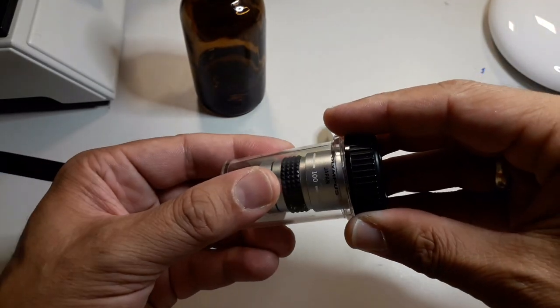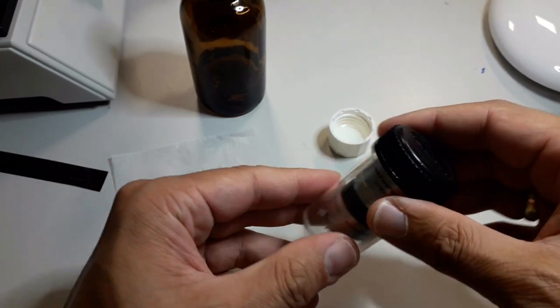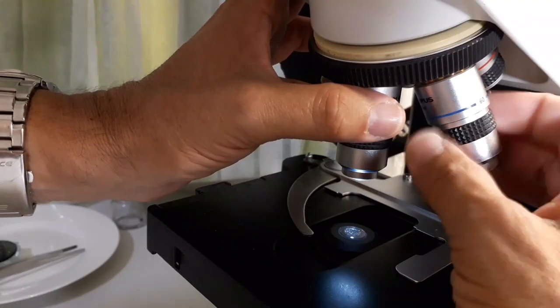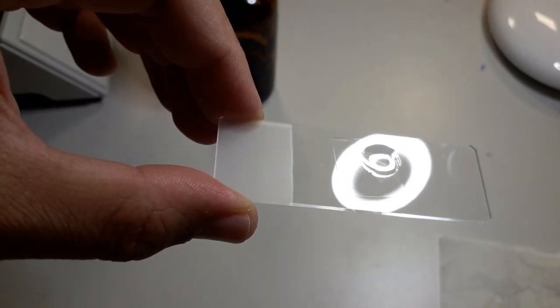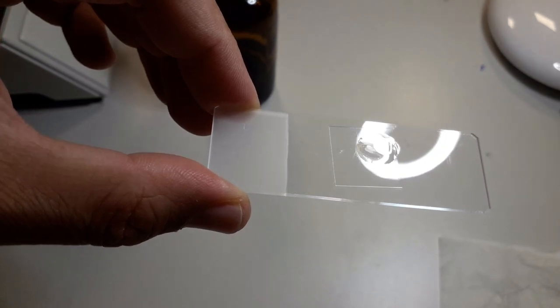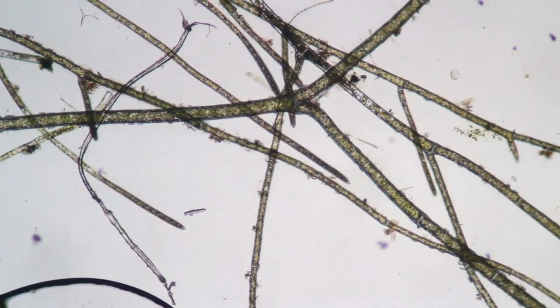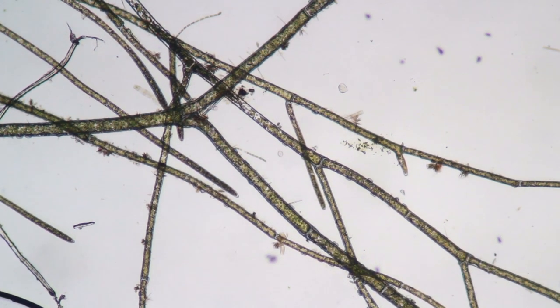I'm basically now putting it away into its case again to be locked away. What we're going to do now is I'm just going to show you how the whole thing looks like under the microscope, how the algae looks like under the microscope. Of course I have to put back, that's the oil on the cover glass.